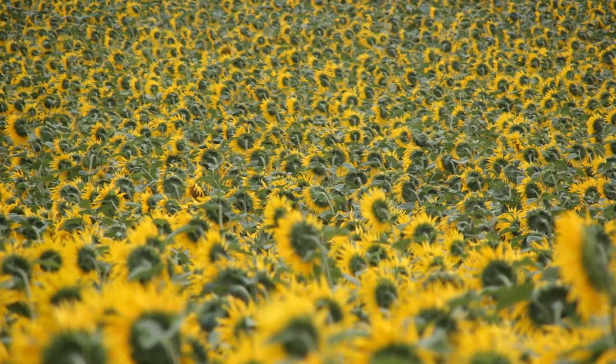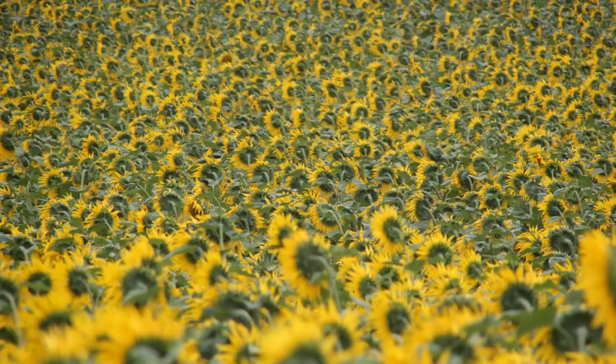I'm here again because today I want to show you how to make a so-called glue imprint of a leaf surface. What I want to do is apply a little bit of glue — I've got some glue here — and I want to apply this glue on the bottom side of the sunflower leaf. I'm going to allow it to dry there.